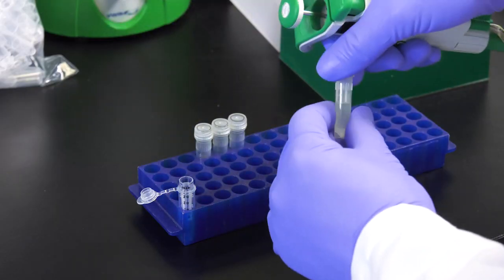The resin in the R1 reagent forms a pellet at the bottom of the tube while the DNA is in the supernatant. Now to purify the DNA.